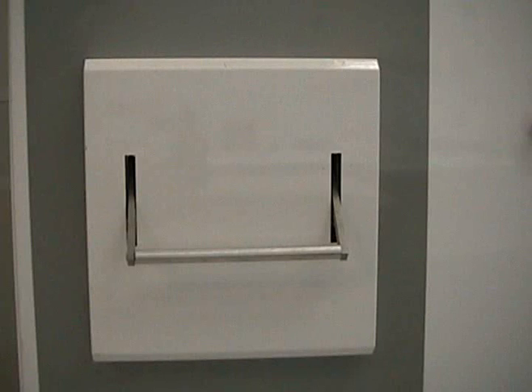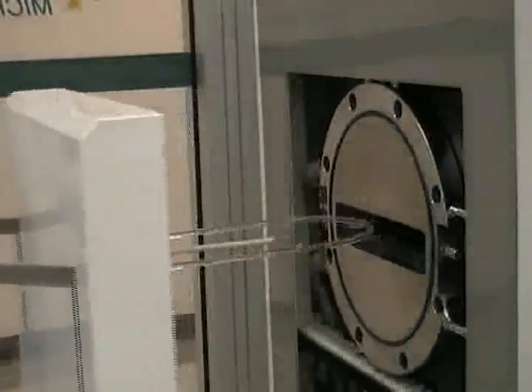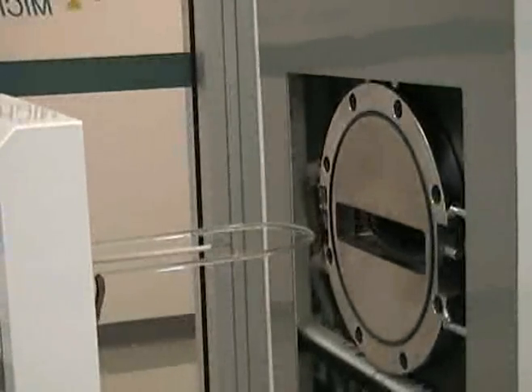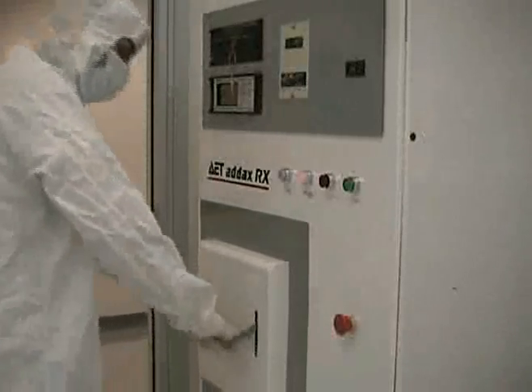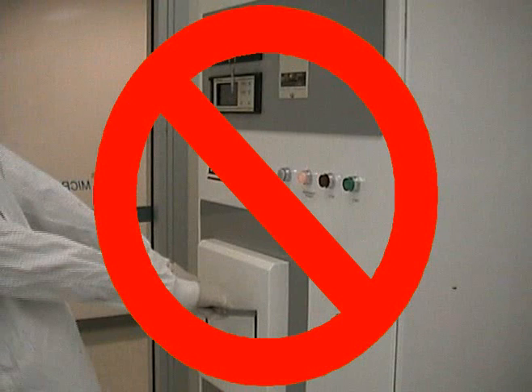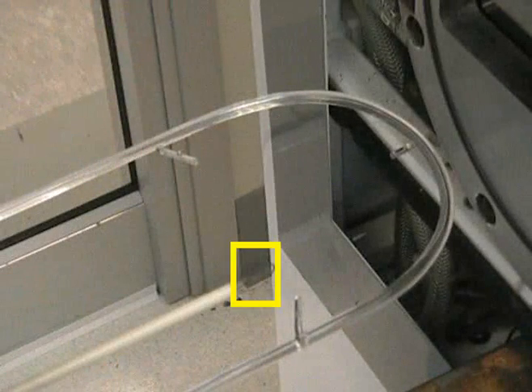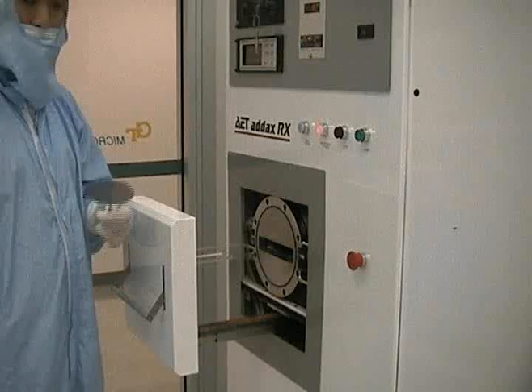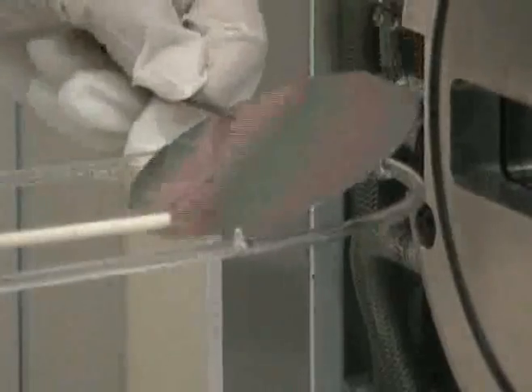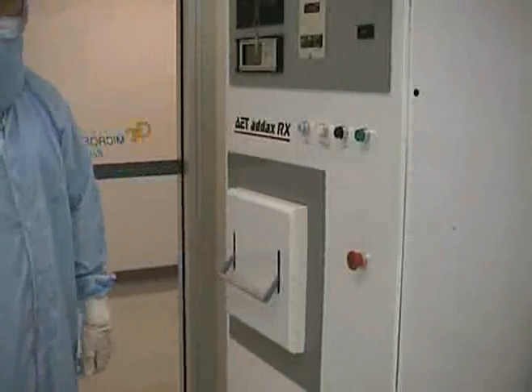We will go over the procedure for loading a sample. Lift the bar on the chamber door and gently pull the door open. The sample holder is set up for a 4-inch wafer. If you find the chamber door locked, please contact MIRC staff. Be extremely careful with the quartz holder and thermocouple wires. Place your sample on the holder. Lift the bar and carefully close the chamber door. Once the door is closed, push down on the bar to seal the door.